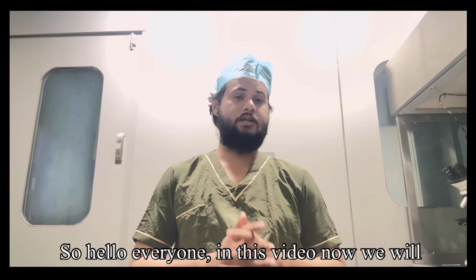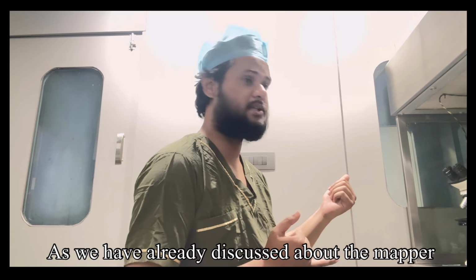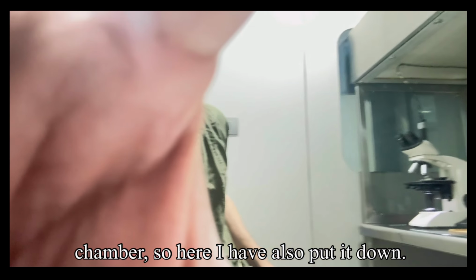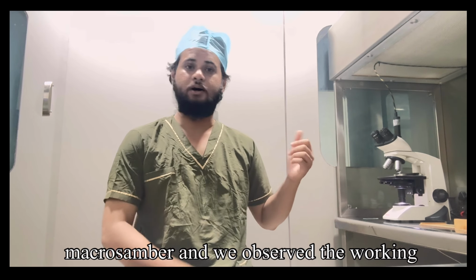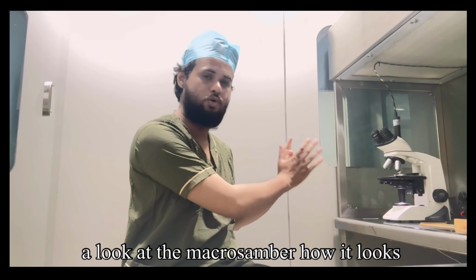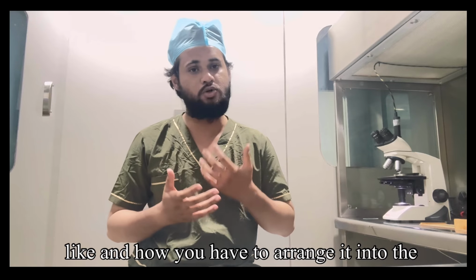So hello everyone. In this video we will look at the cell counter. As we have already discussed the Makler Chamber, here I have also put it down. In the last video we looked at the Makler Chamber, how it looks and how you have to arrange it in the microscope.